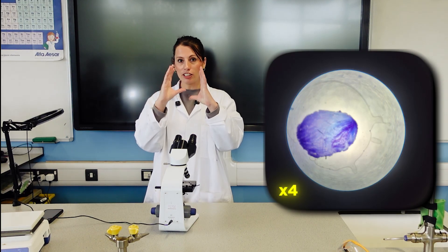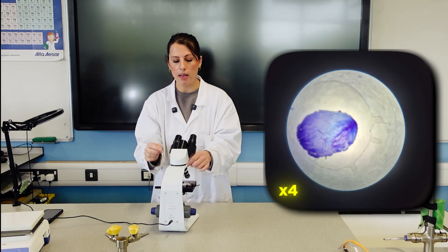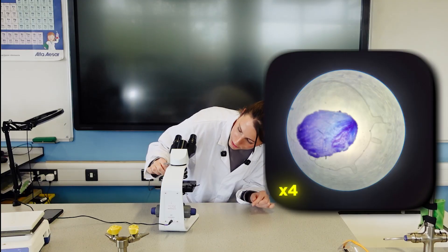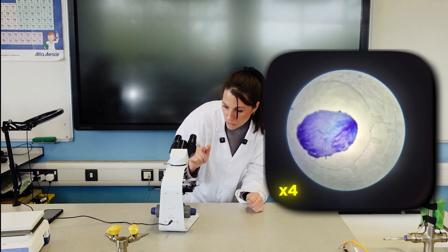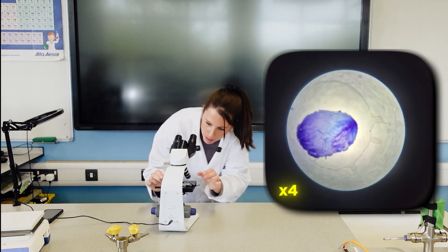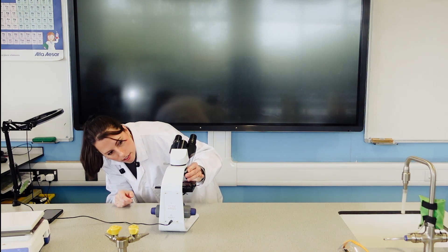Now I've actually got it in the correct position, I can move up a magnification. So for context, that was my four times magnification lens. And now I'm going up to my 10 times.